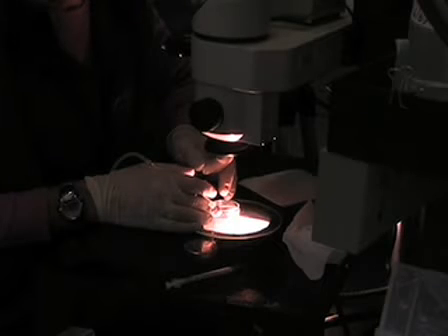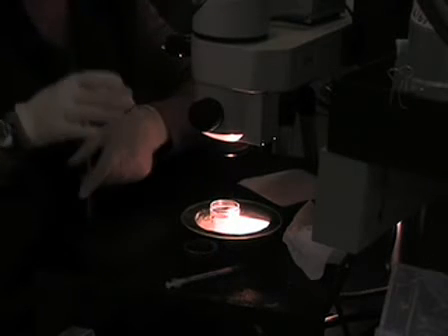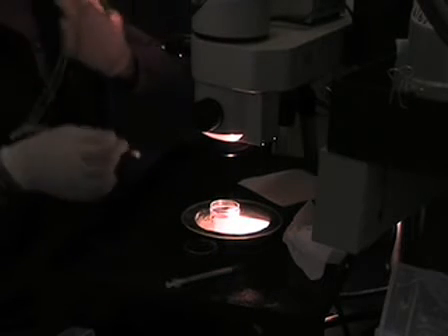Once you focus on the fat pads, you look for what looks like droplets of fat that are perfectly symmetrical. There's one right now just to the left of that long fat. That's a single cell egg. So what I'm going to do is take the mouth pipette, pick up the egg, put it into some more holding media so that we can isolate the eggs themselves.